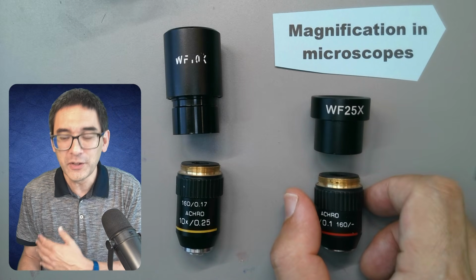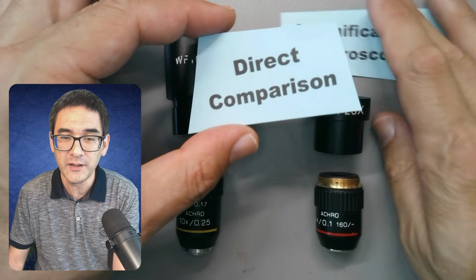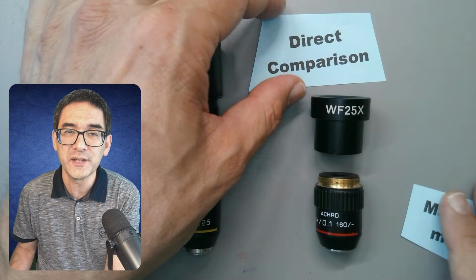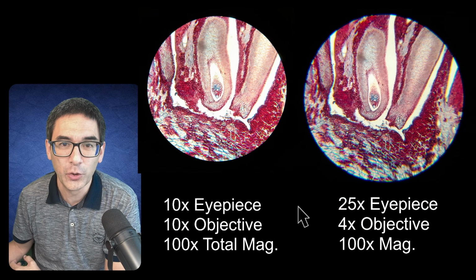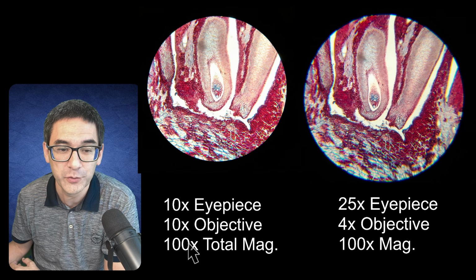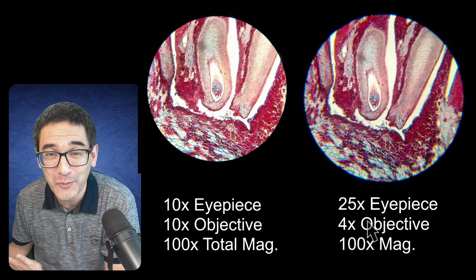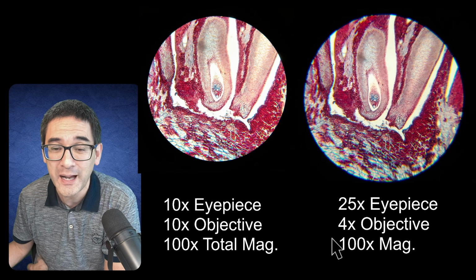Okay, so what I'm going to do now is have a direct comparison between those two by putting something directly under the microscope. Let's have a look. Well, this is how it looks under the microscope. Here on the left side, 10 times eyepiece, 10 times objective, 100 times total magnification. Same on the right side here, that's the 25 times eyepiece, 4 times objective, same magnification as well.